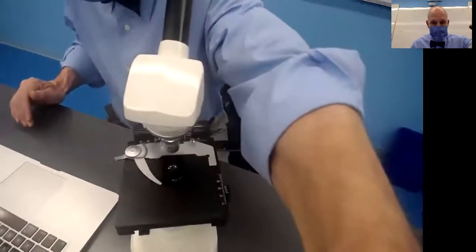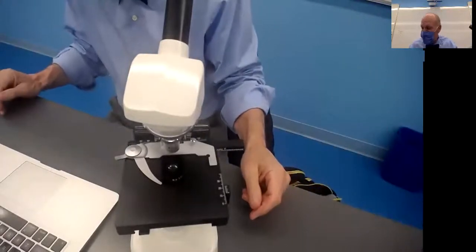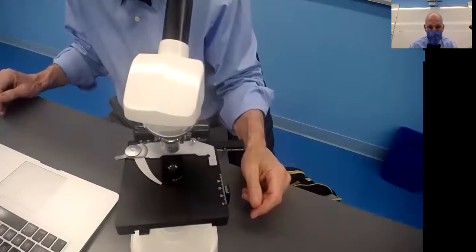Today I need to show you how to use the microscope if you're a remote learner. Right now this is all you're going to be able to see. I'm going to ask you some questions about it, so you need to pay attention.